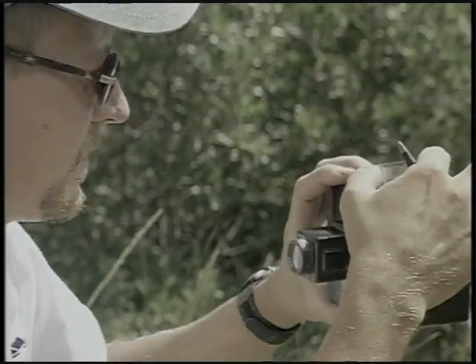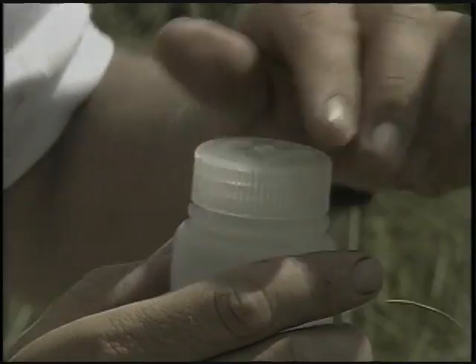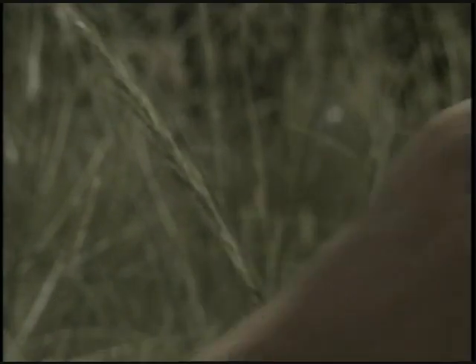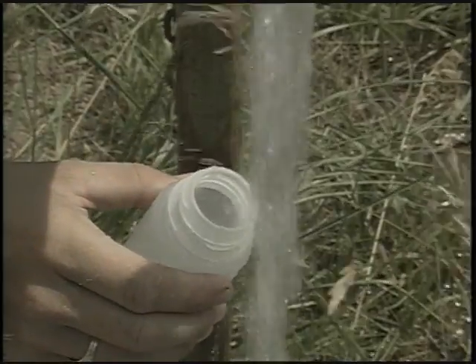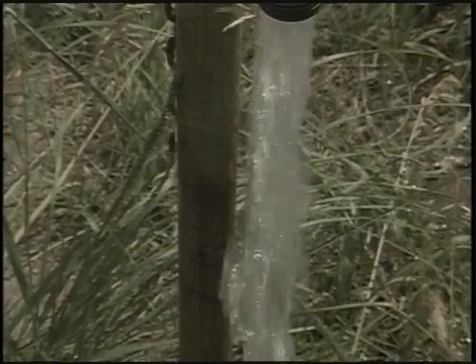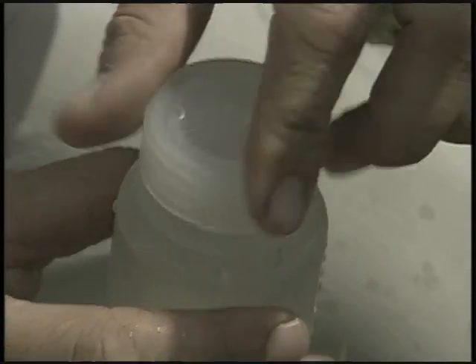For a sample to be accurate, it must be free from outside contamination. Some sample locations are more likely to contaminate a sample than others, and they should be avoided if possible. This is especially important for microbiological samples.